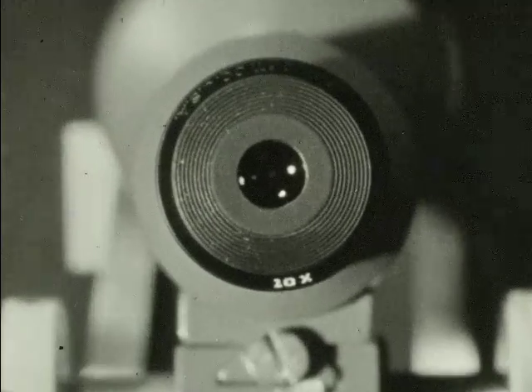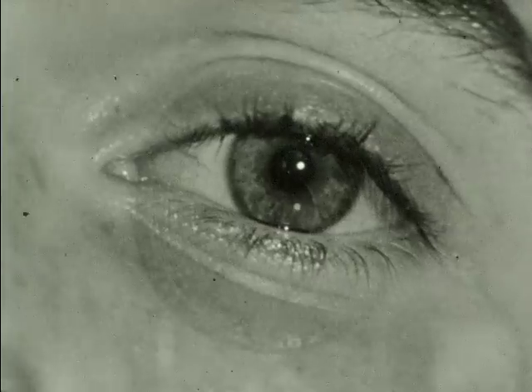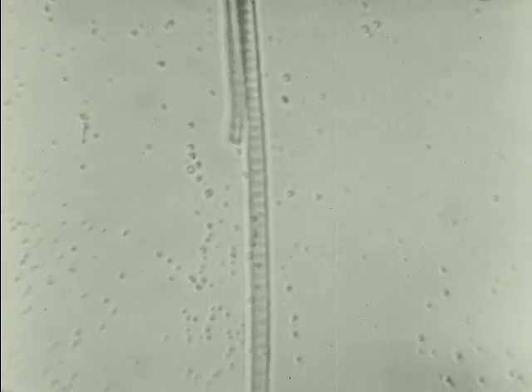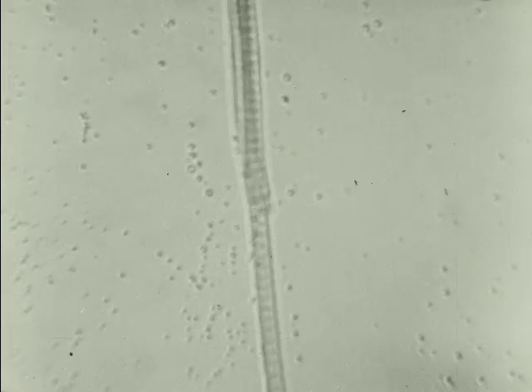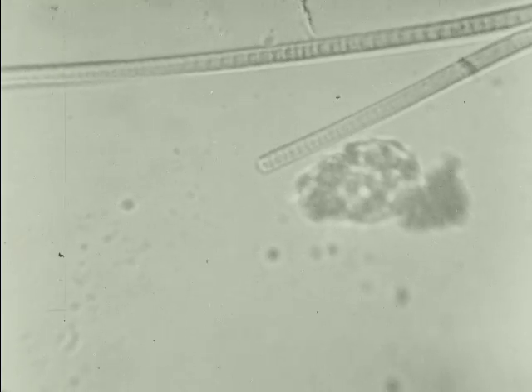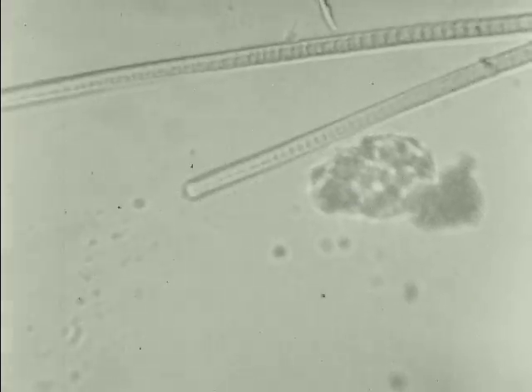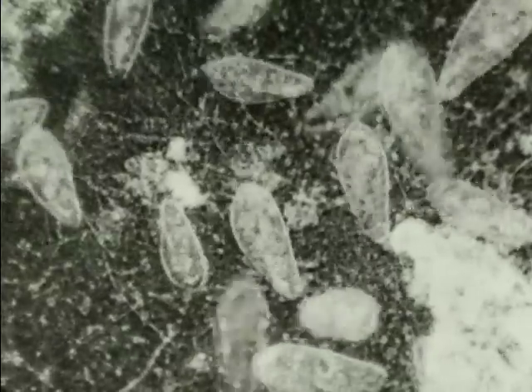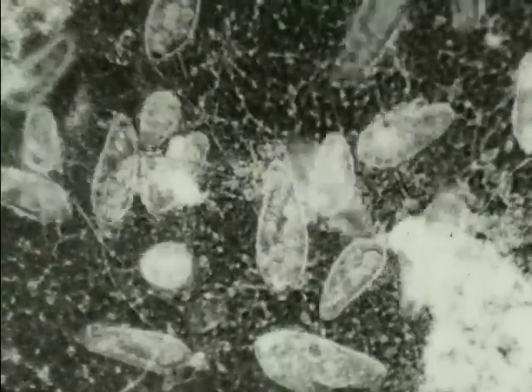The powerful eye of the microscope extends the range of your eye when you use it correctly. The microscope is your window into the world we seldom see, a world of strange creatures. A world where a single drop of water may be teeming with scores of one-celled animals. And yet, this strange world is yours to explore, yours to investigate by means of your microscope.